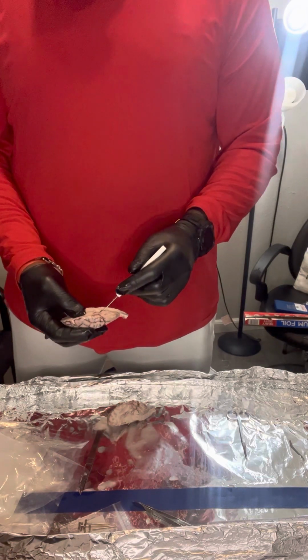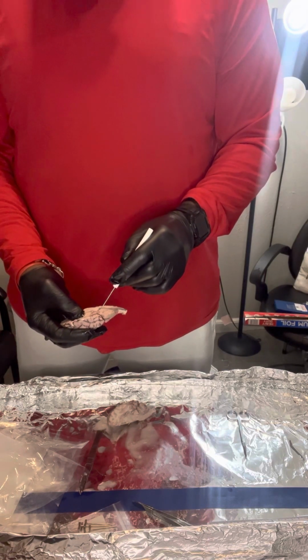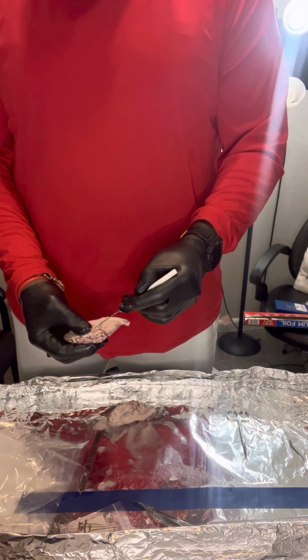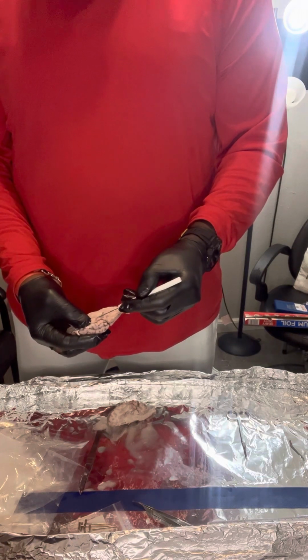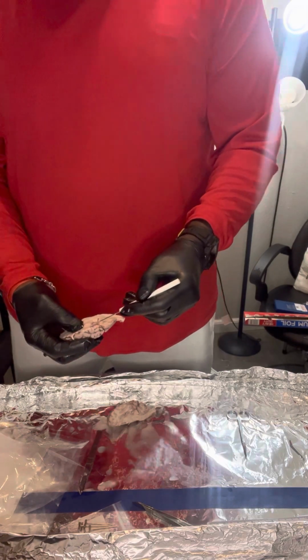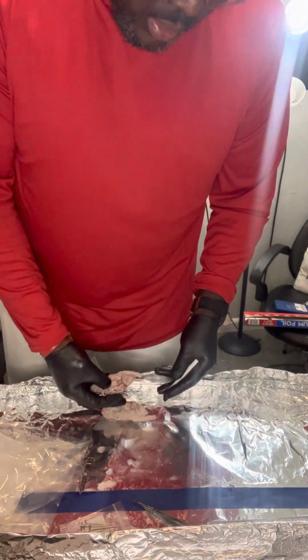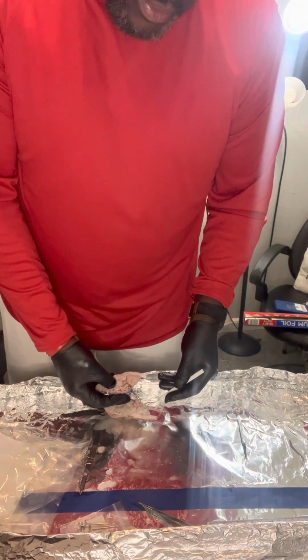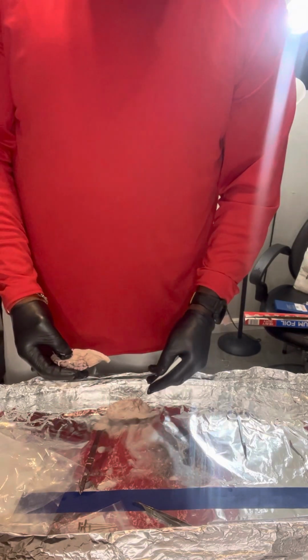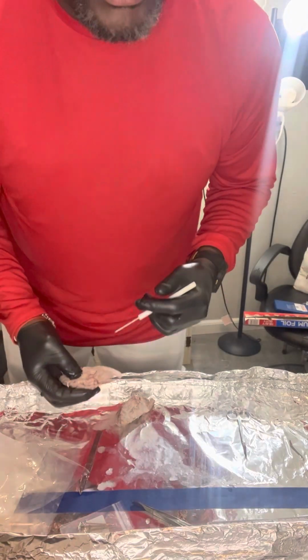Inferior colliculus, and it is actually located here. So this is the superior right in here, and this is the inferior right in this area here, almost close to the pons, I believe. It is interesting how these two halves, I see this more now. I see the cerebellum more now here. I guess it needed to dry out. That's interesting. I might switch what I'm using. Anyway, running out of time. Oh, almost out of time.